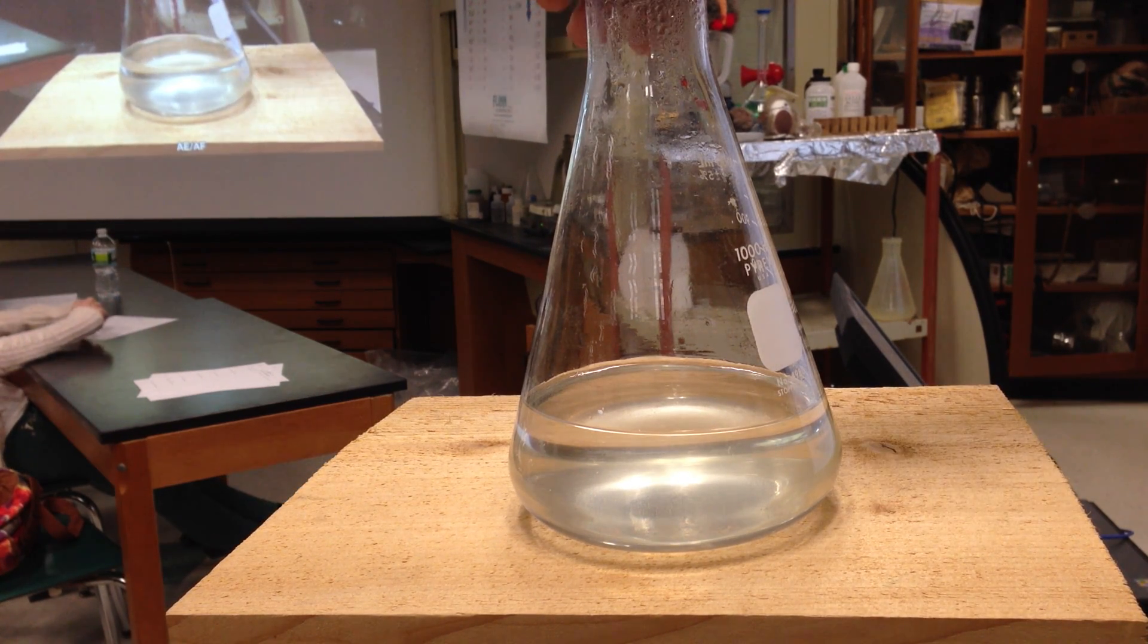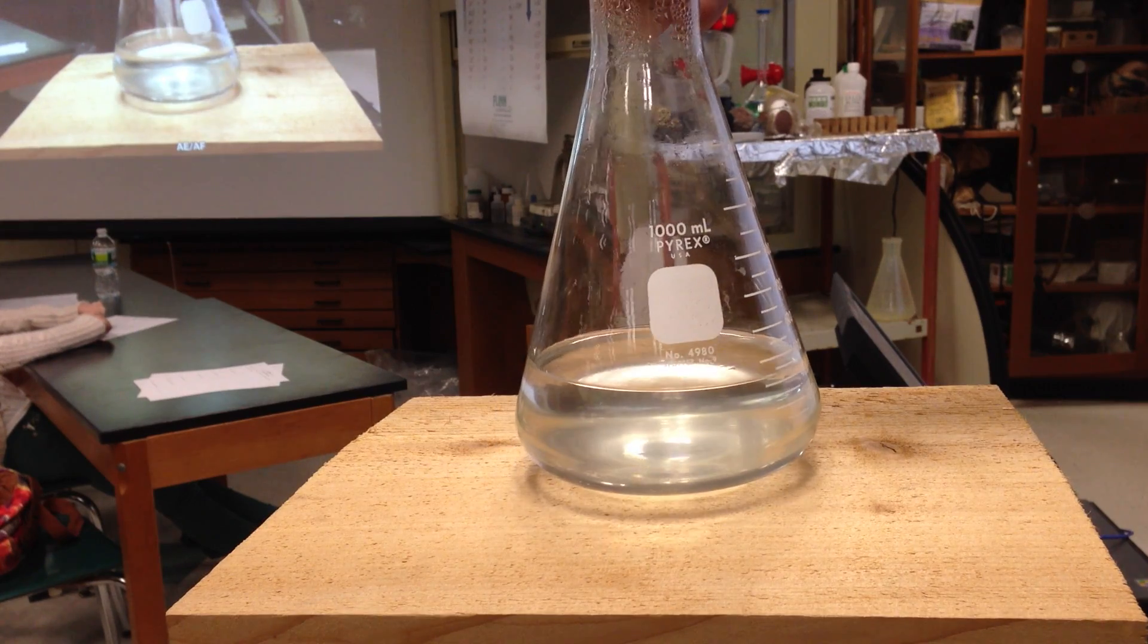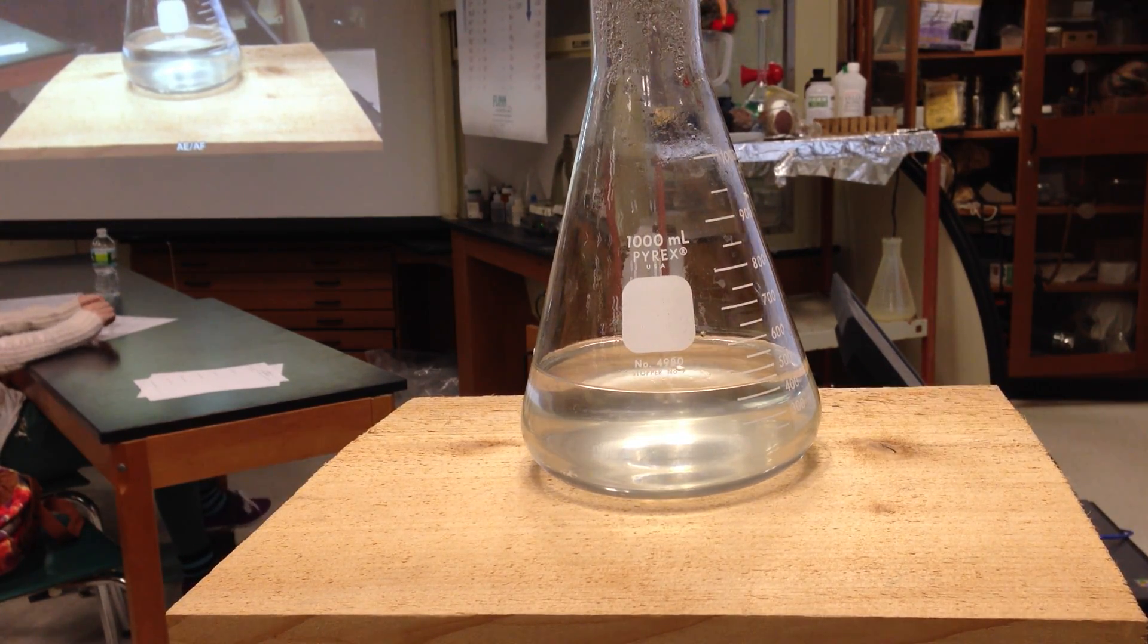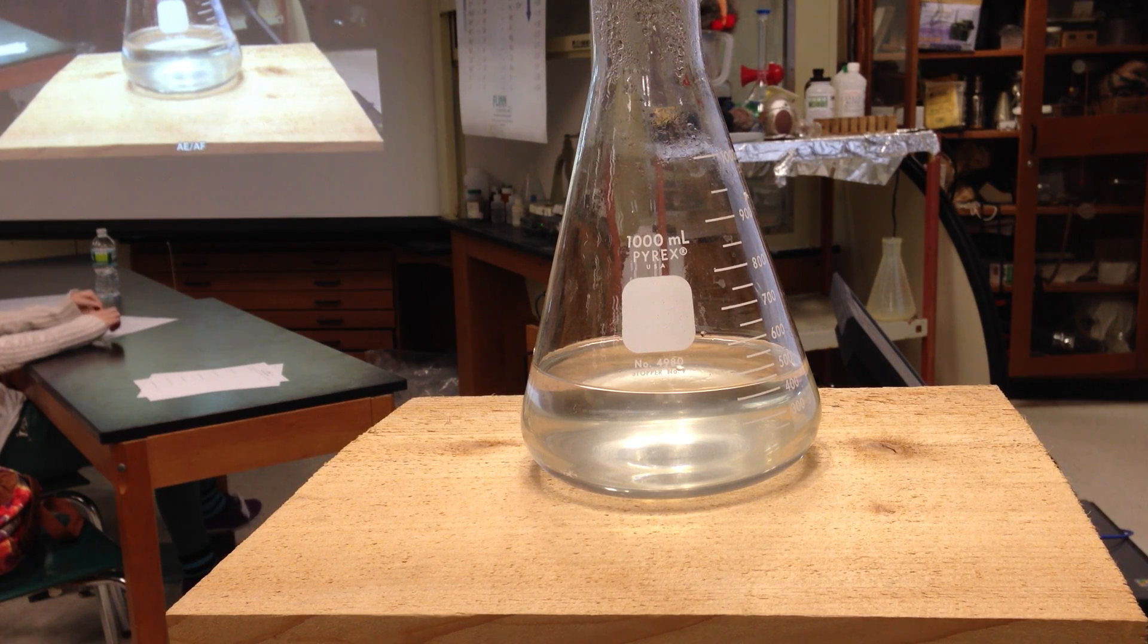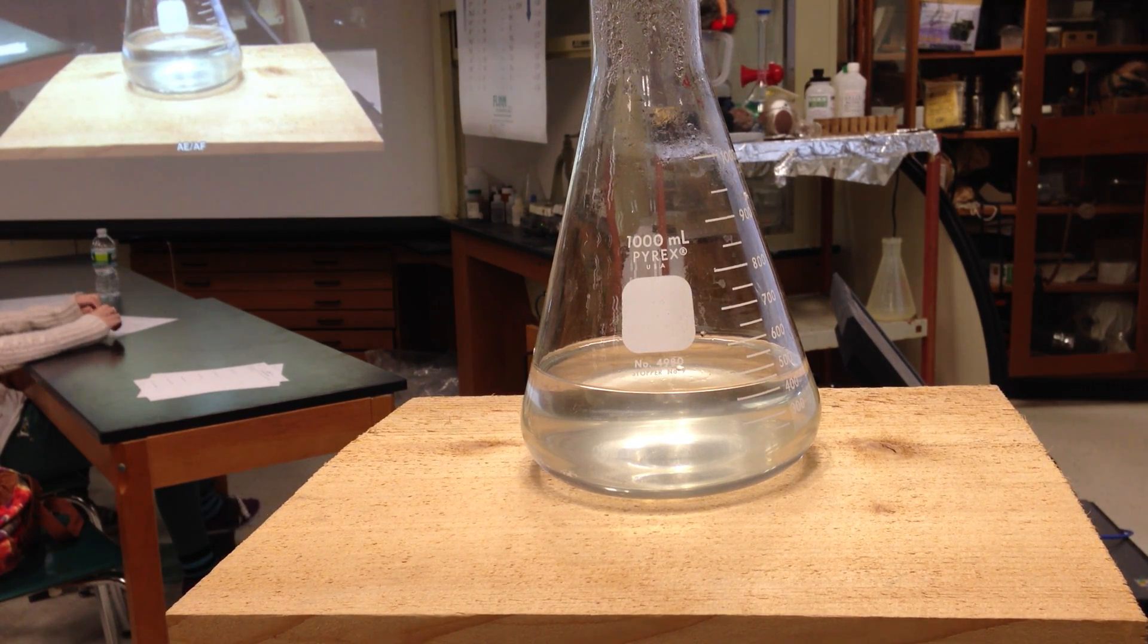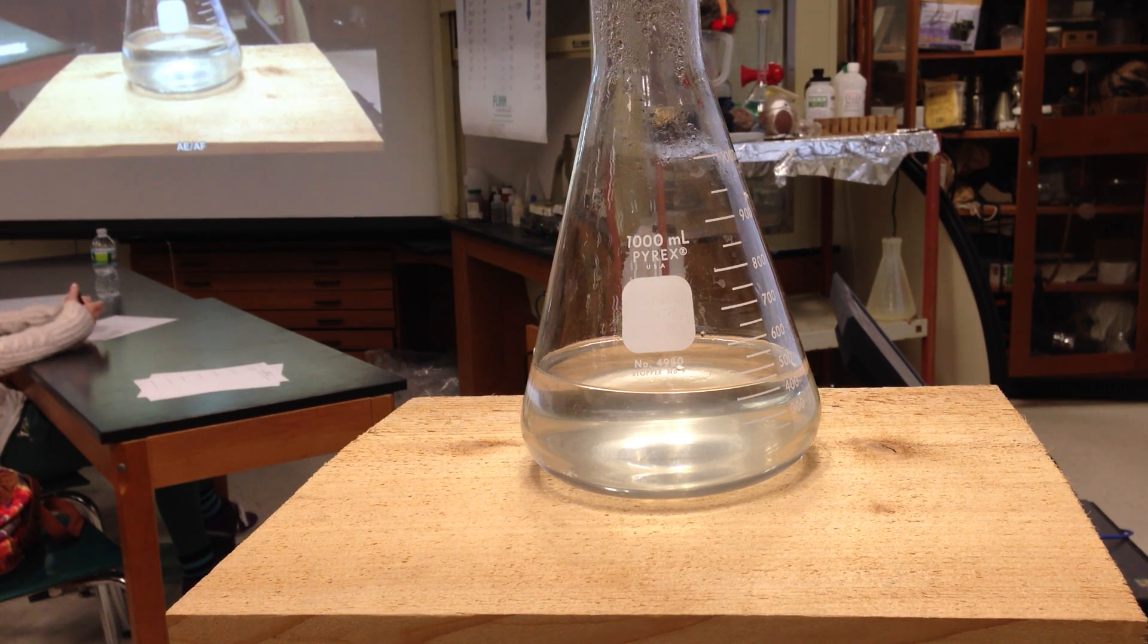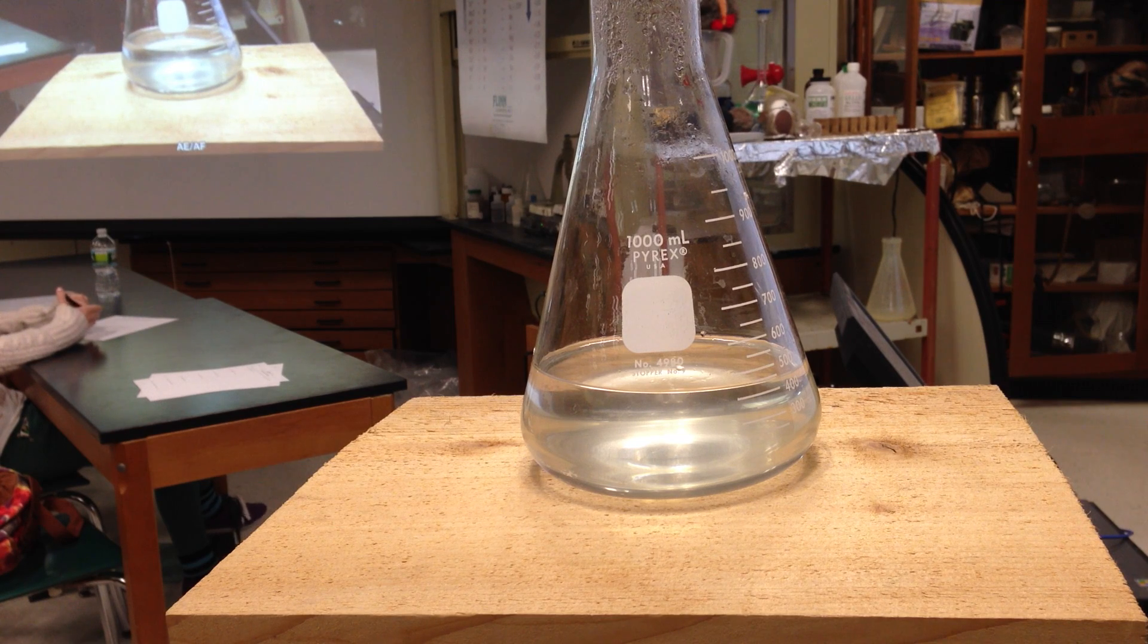As we've talked about, this is a solution of sodium acetate, and it makes supersaturated solutions very easily. As long as I heat this solution and keep adding more and more sodium acetate until it's almost all sodium acetate. So there's a tremendous amount of sodium acetate, just a very little water in this, believe it or not.